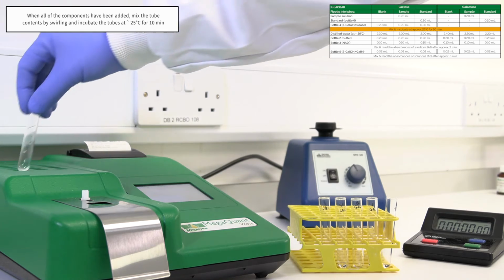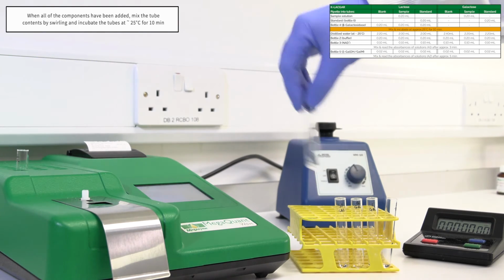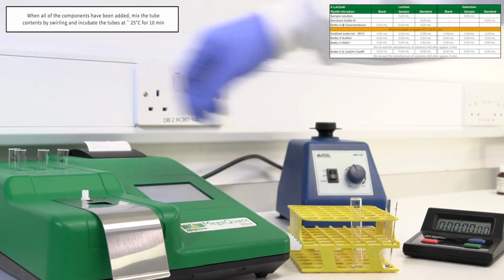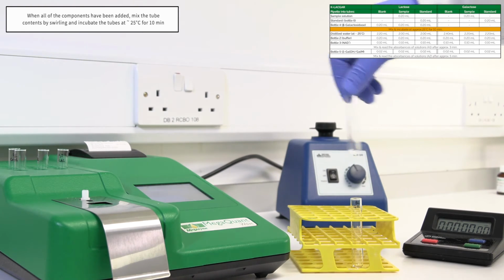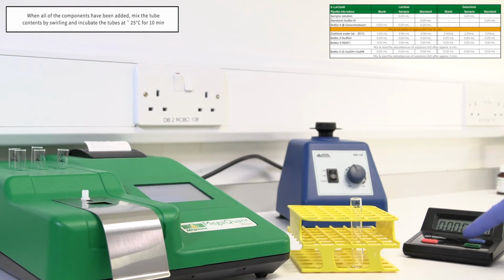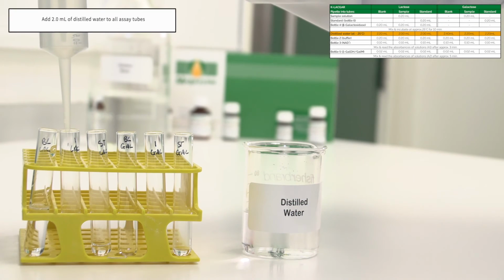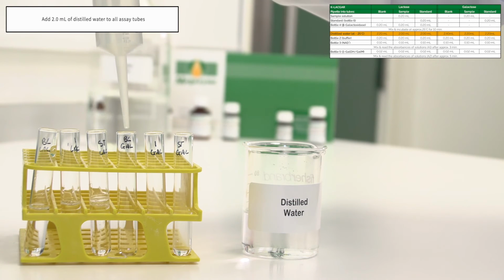When all of the components have been added, mix the tube contents by swirling and incubate the tubes at approximately 25 degrees Celsius for 10 minutes. Add 2 millilitres of distilled water to all assay tubes.